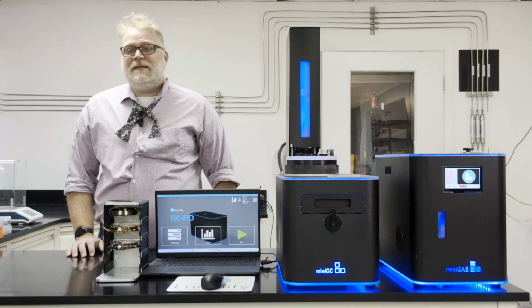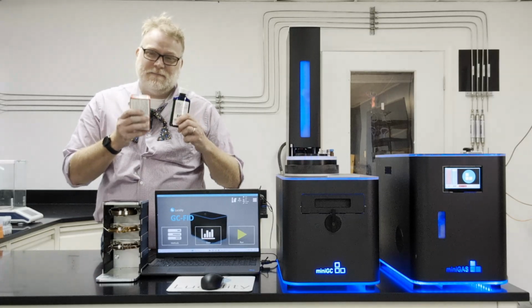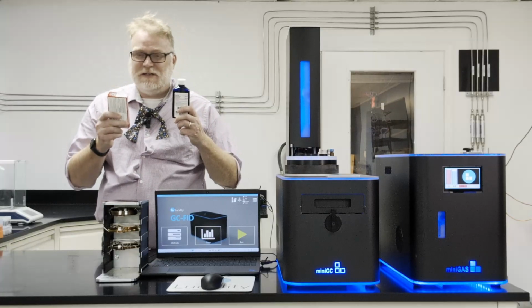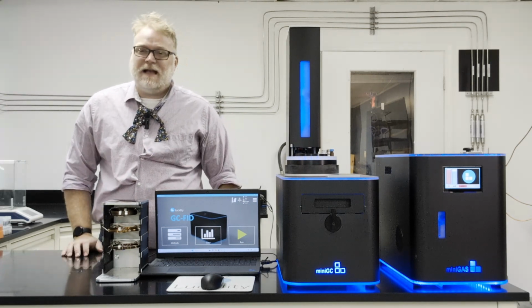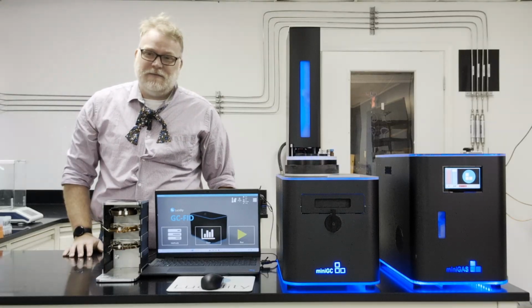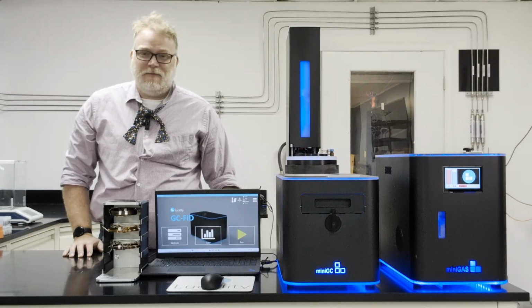We asked what you wanted to see analyzed, and someone suggested cold medicines. I just happen to have some right here. You've got some for cough, some for nasal decongestant, and some for help with excess mucus. Normally, these medicines would be analyzed on an HPLC, but it's all the way over there, and I'm not feeling good enough to make that trip. And the GC is so close, so I don't have to move very far.